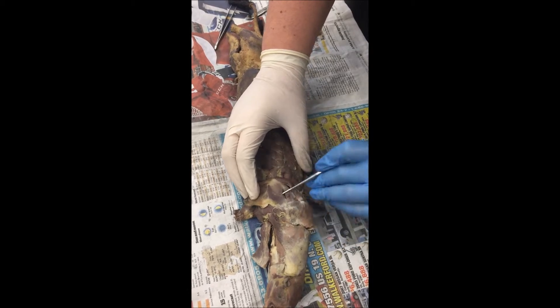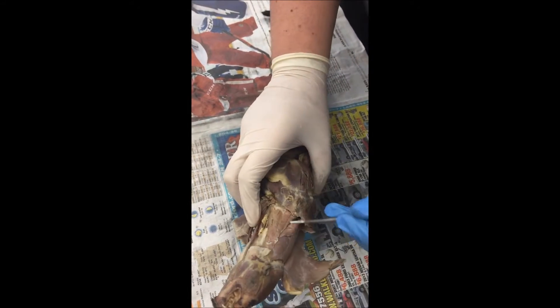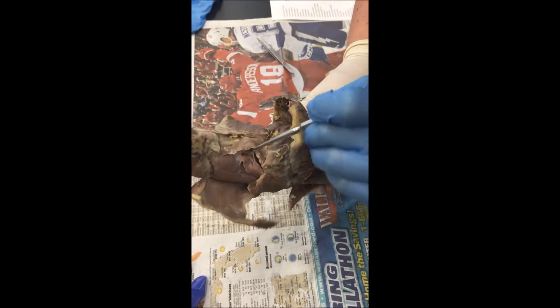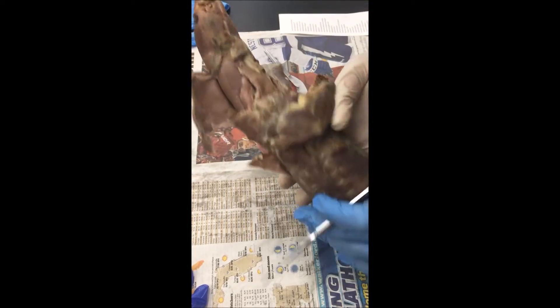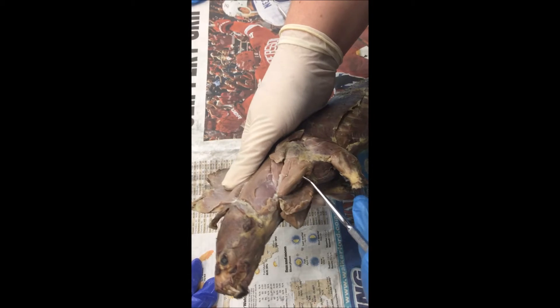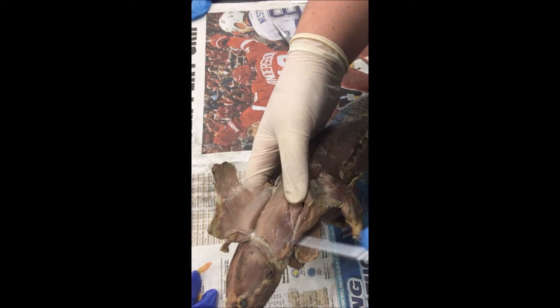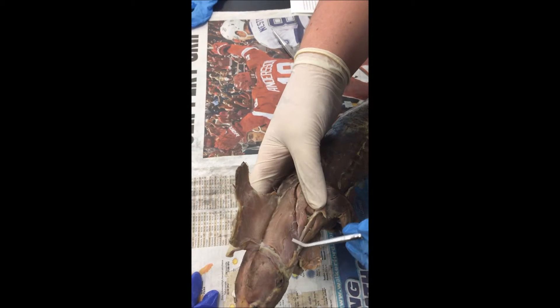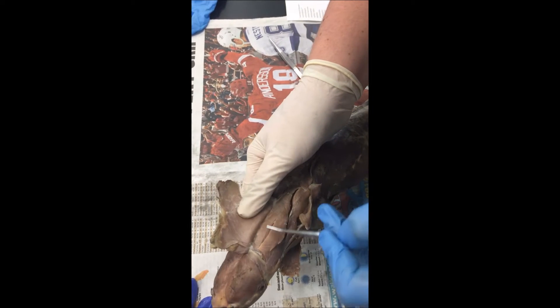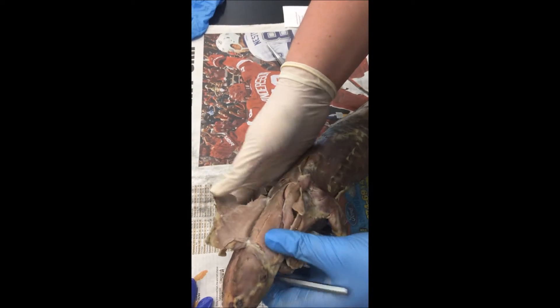Lateral head of triceps. This is the cleidomastoid. Levator scapularis, atlantoscapularis, splenius, rhomboideus capitis, rhomboideus cervicis, down to the rhomboideus thoracis.